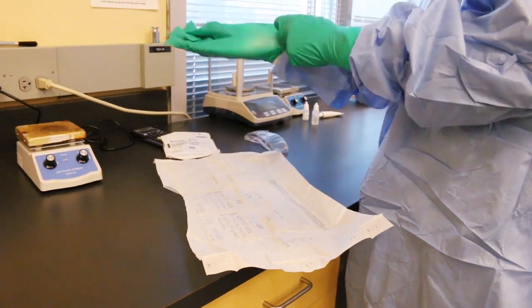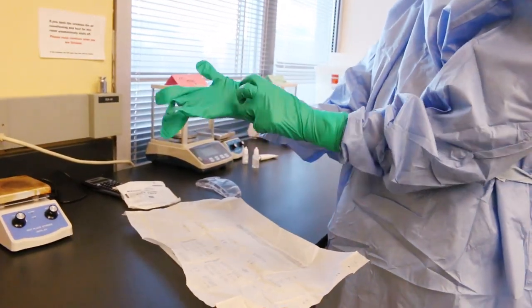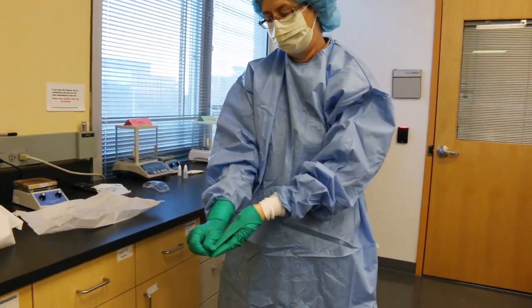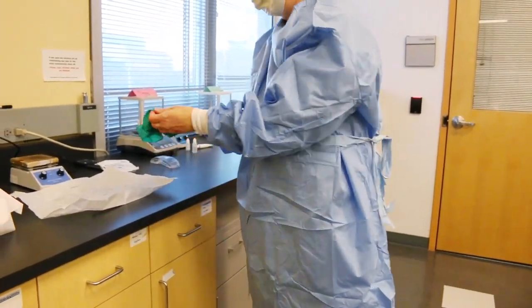The skill is completed. Step 27 is removal of protective personal equipment.